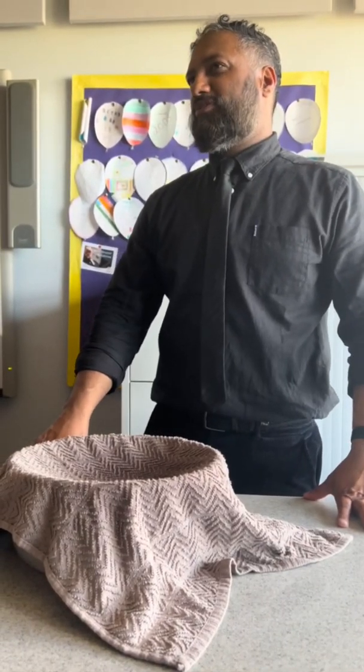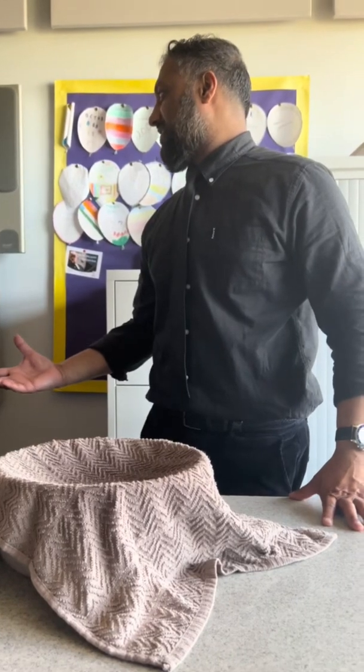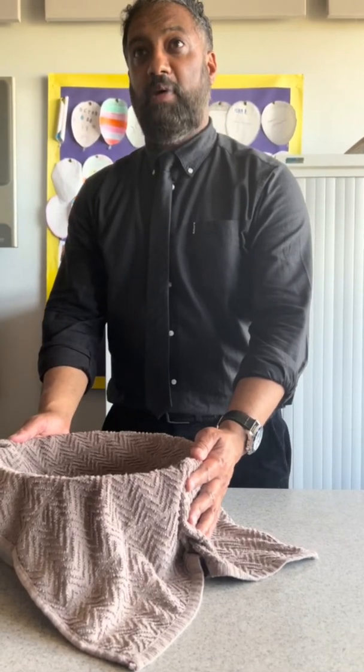Before we start, how many of you have done this before? No. Oh yeah, dissect the octopus. I've done a squid. Done a squid? I've never done one. Here you are. It is alive, by the way.